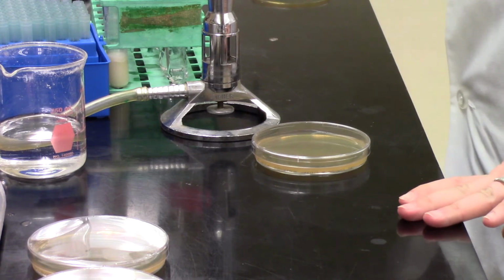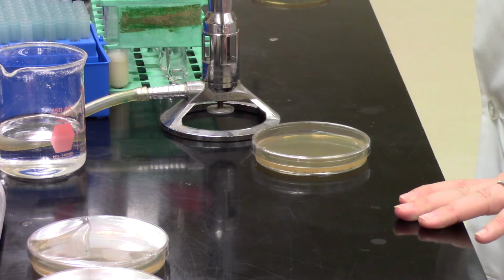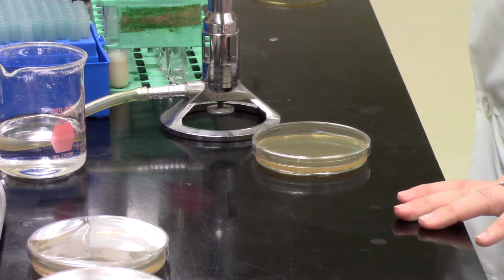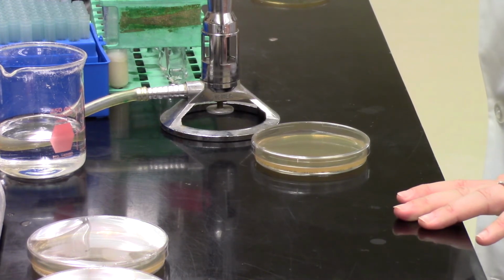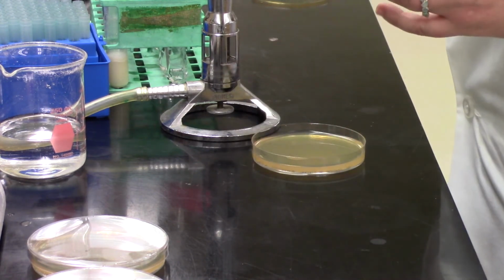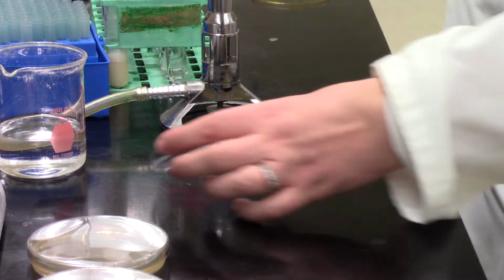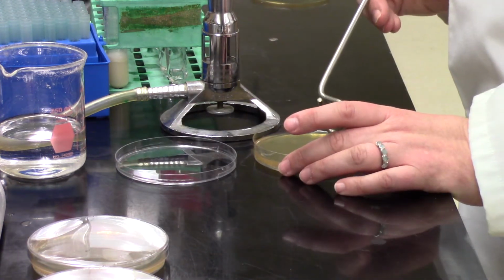What was the one that had the most? But we're not going to take you through the full dilution series here, and we're certainly not going to start on the yogurt as well and give you the world's longest video of spread plating. So we'll do one more plate with this capsule sample that we have, the diluted capsule sample, and then we'll call it a day for this video.